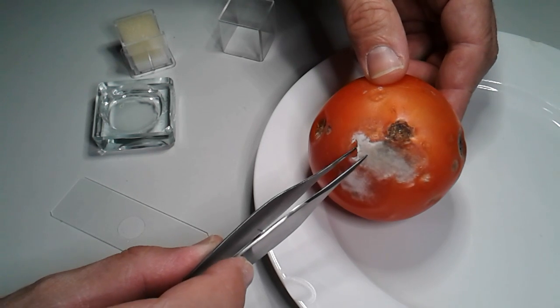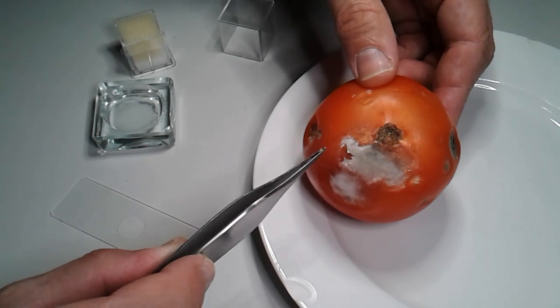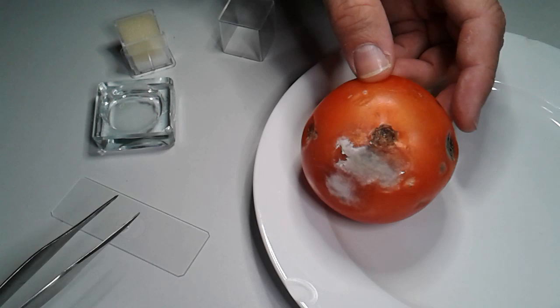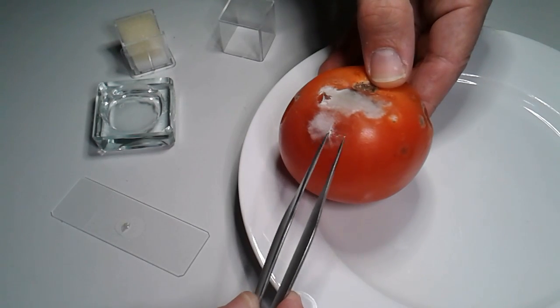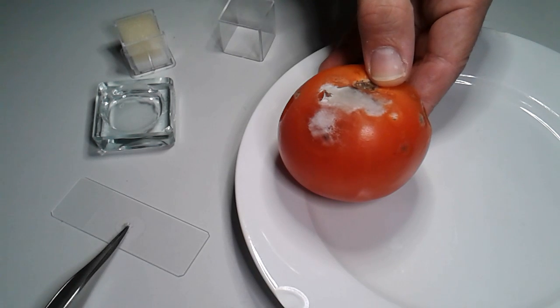The consistency is a little bit like cotton, not surprisingly, because as a matter of fact there are many long strings of cells. And as I transfer them carefully, I try to, if possible, maintain the overall structure of the mycelium.